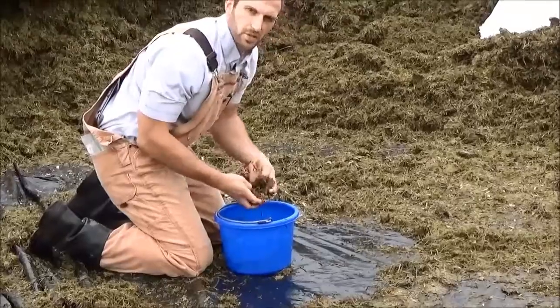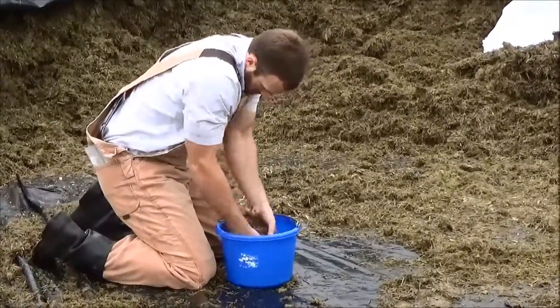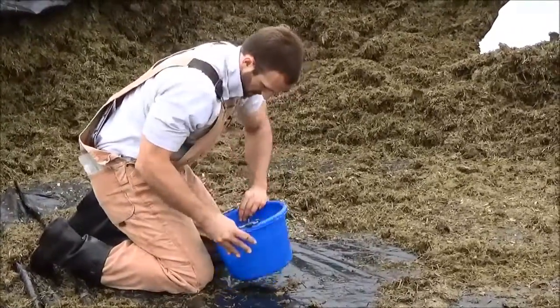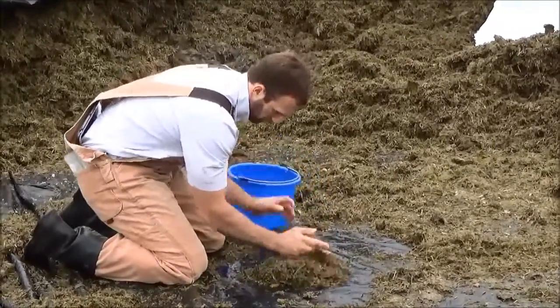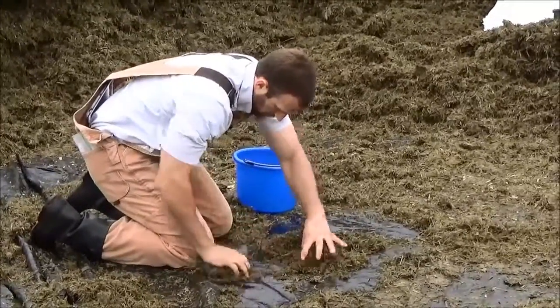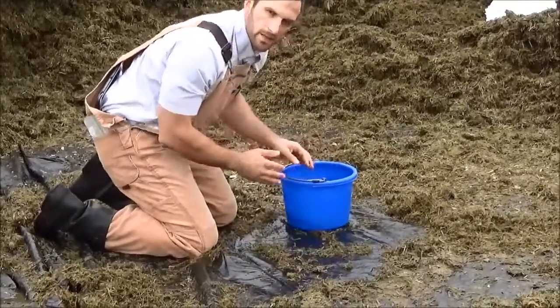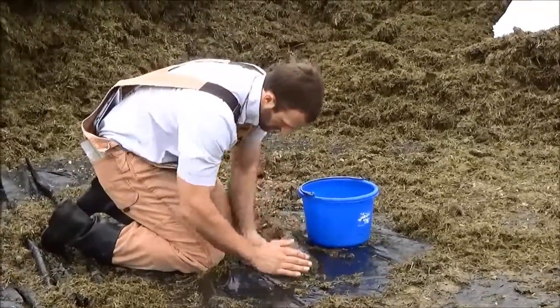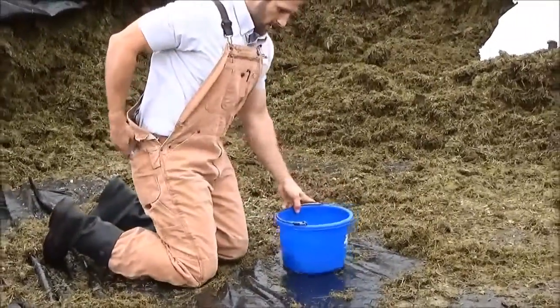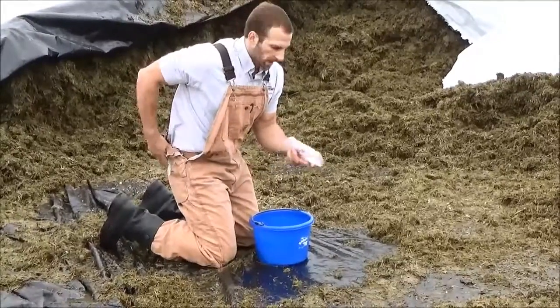I'm finding some additional chunks — break those up. It's a little bit easier on a plastic surface, a little bit more slippery. I'm going to go back to my feed scan confirmation code labeled bag.